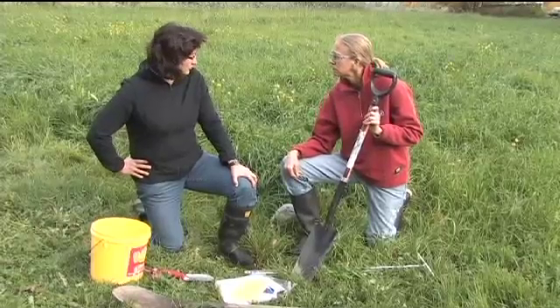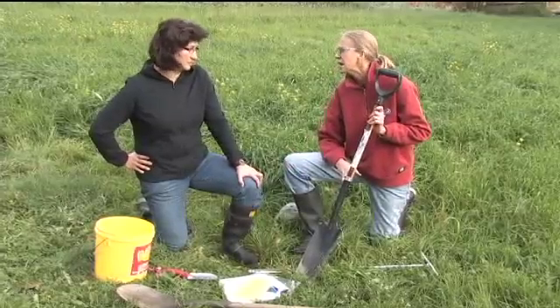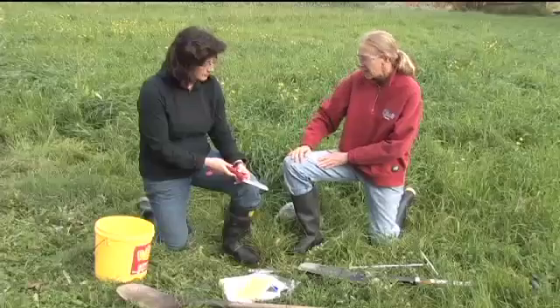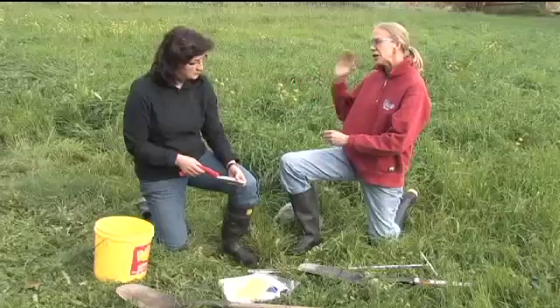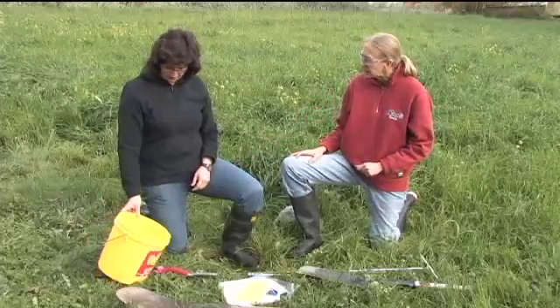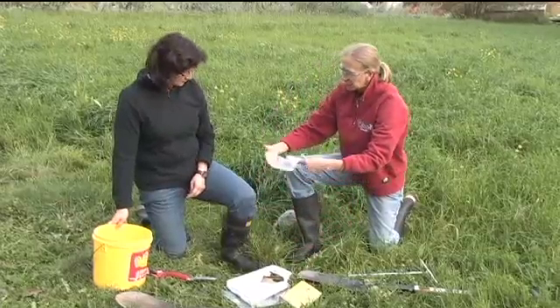It's quite narrow, which is desirable for a farm field where you wouldn't want to disturb the site. So we can dig just to the depth we need, as small a hole as possible, and once we dig the hole we can use the trowel to sample down the side of the hole. For each transect, we take at least five samples, bulk them all together into the bucket, mix it up, then take a sub-sample and put it into our sampling bags, then label each bag.